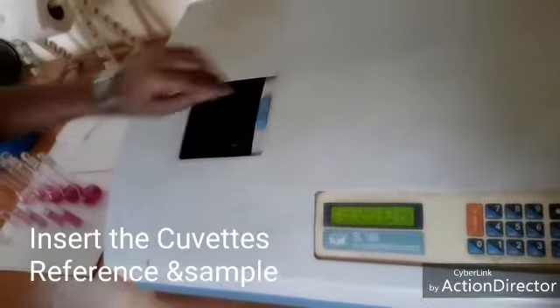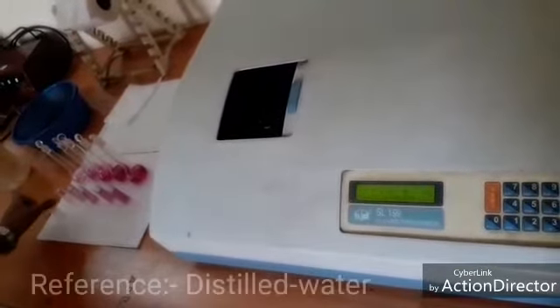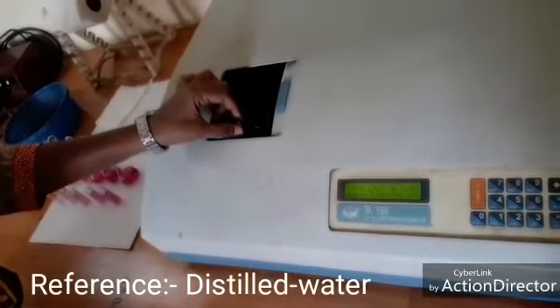Place the samples at reference and sample 1. Reference is water.